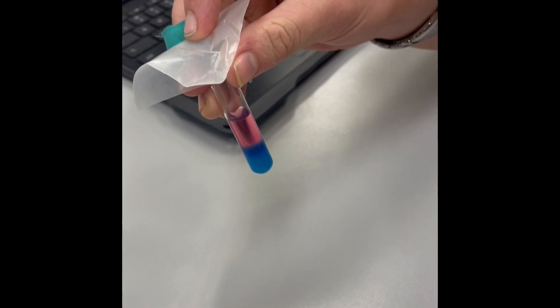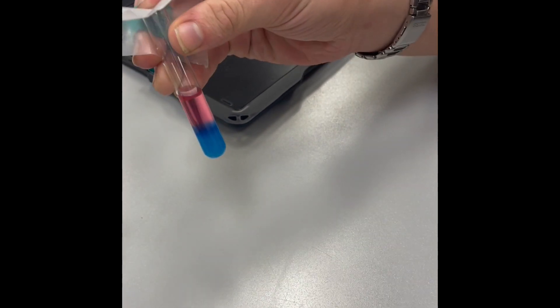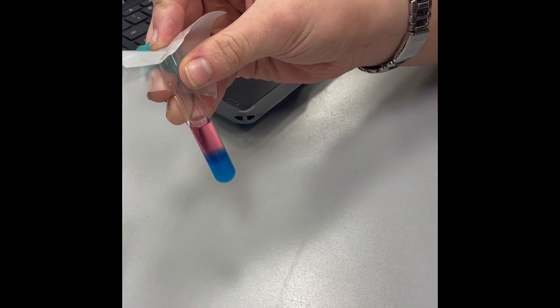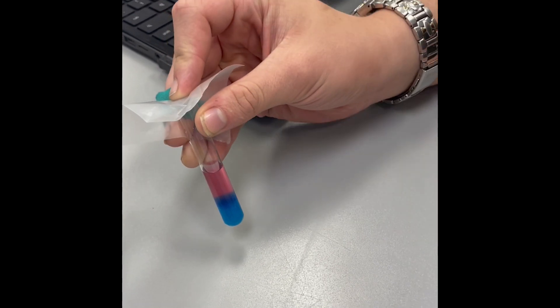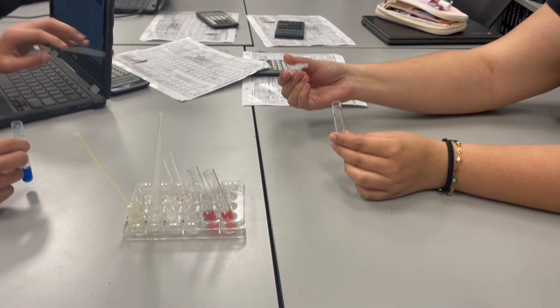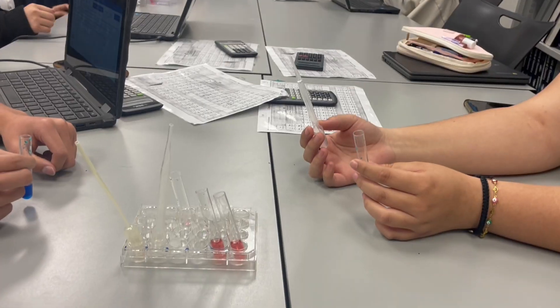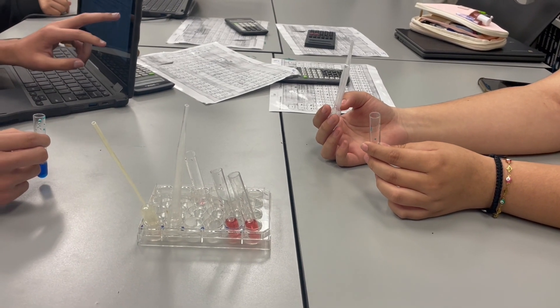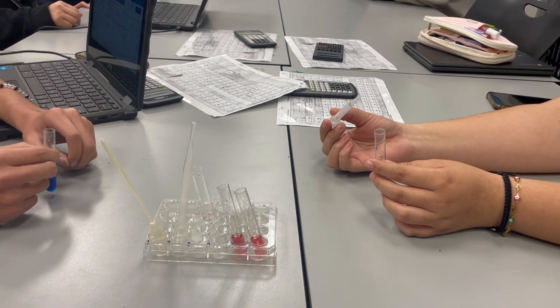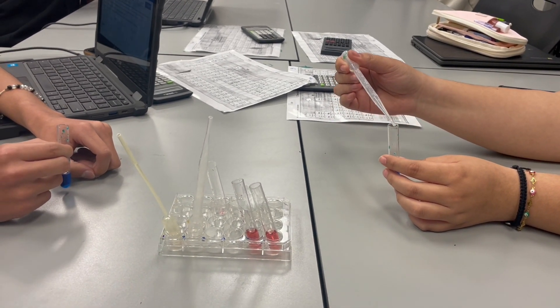I'm adding chloride ions in the form of aluminum chloride into a cobalt chloride solution. Now you're going to mix it up. So where is the system shifting to? What are you adding to the system — is it a product or reactant? Product. So where will the system shift to?